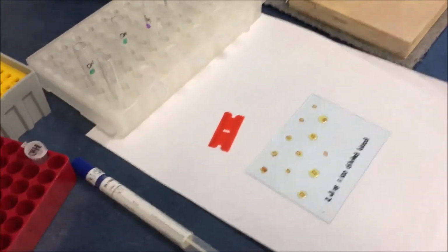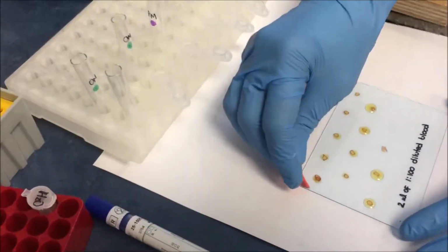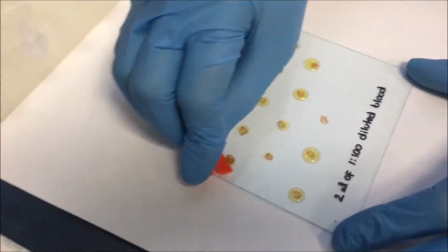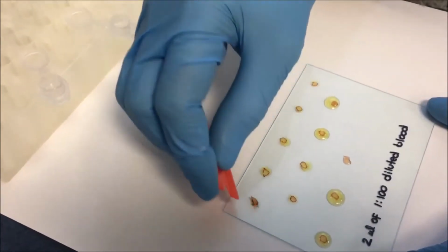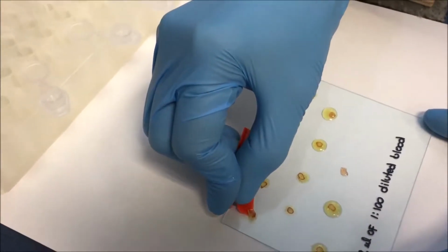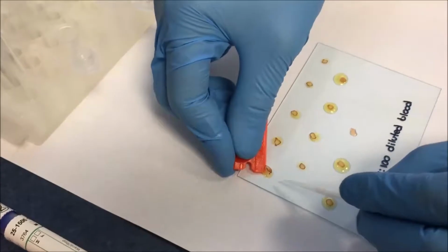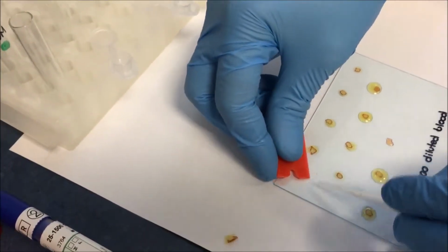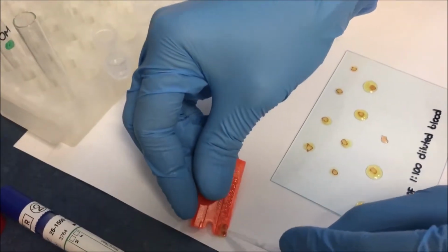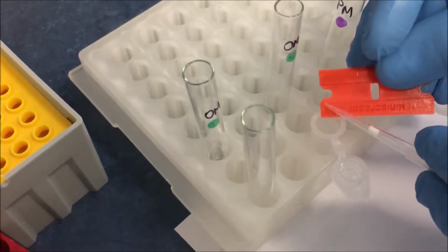Now we are going to show you the actual collection of the sample with the Omni-Matrix, which in this case was applied with a dropper. We can just pick it up, and after picking it up, it is deposited directly. If you notice, almost 100% of the sample is picked up. In this case it just flew over, which is okay, and it is deposited into a microtube.